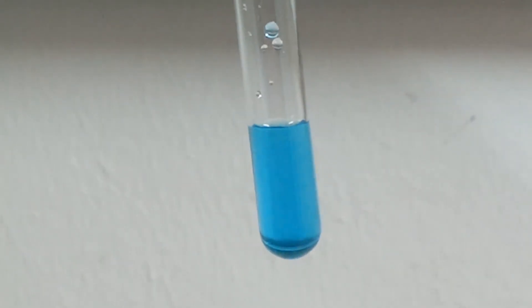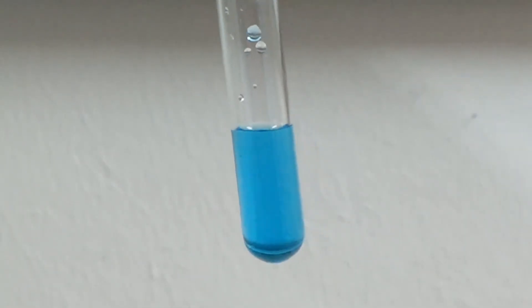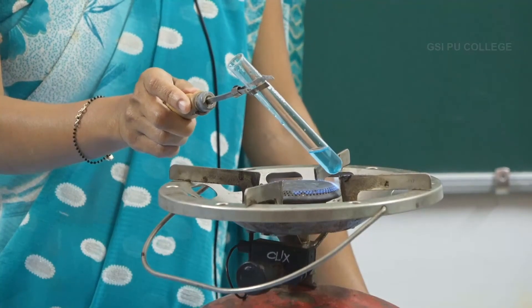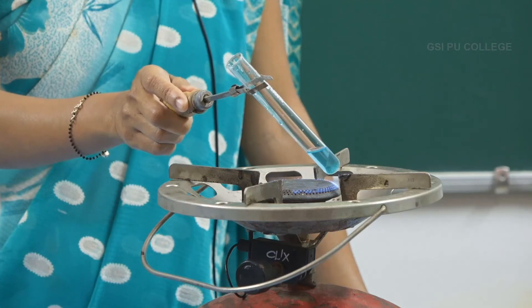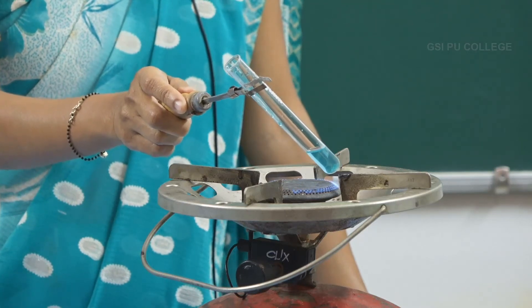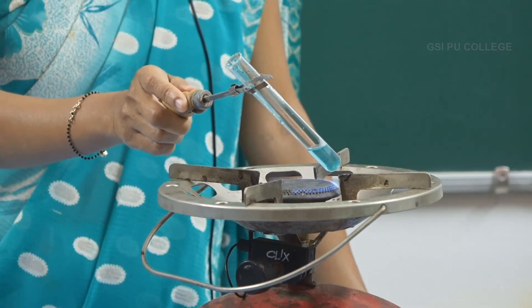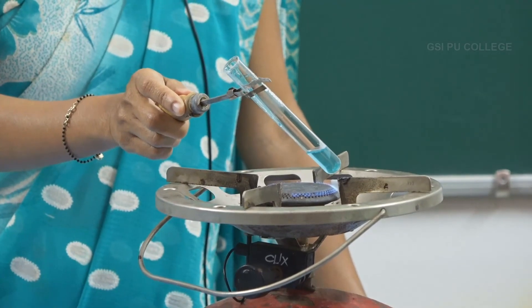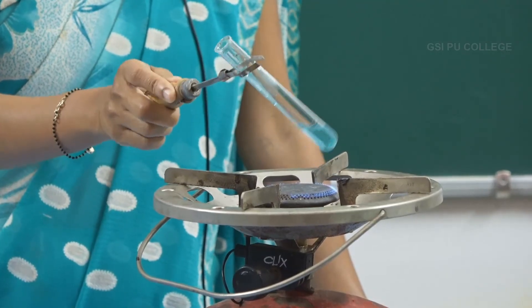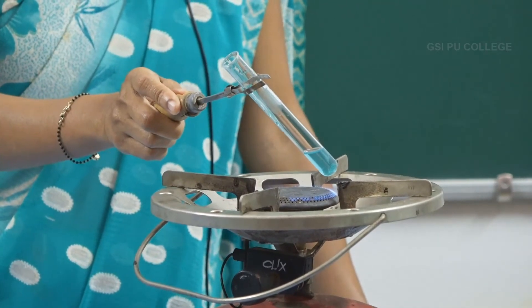Next, place this test tube in a test tube holder and heat it. As you heat, you can see the colour slowly changing from blue into green, indicating the presence of glucose at about 0.5% in the urine.